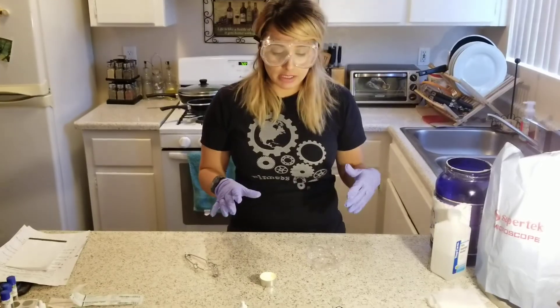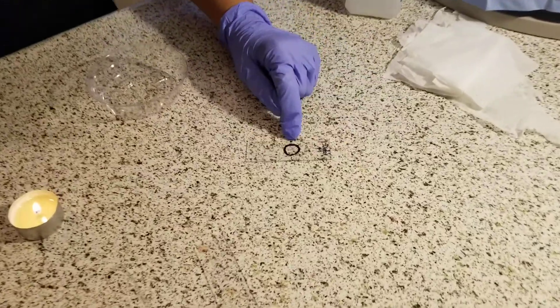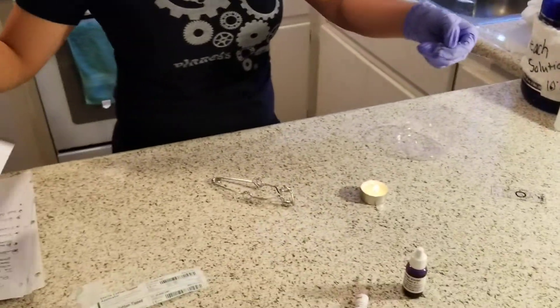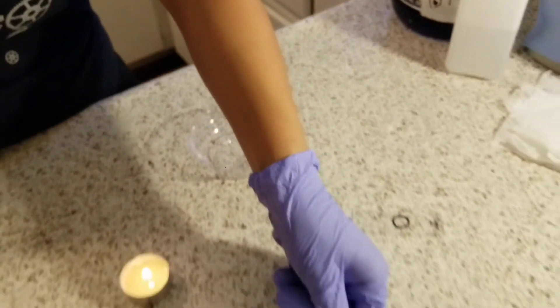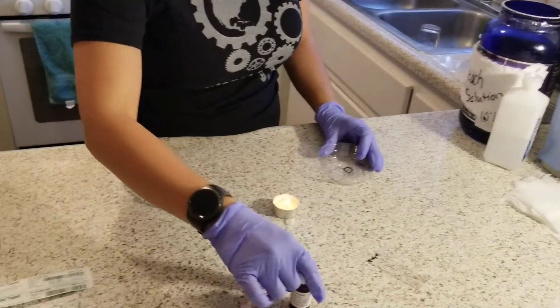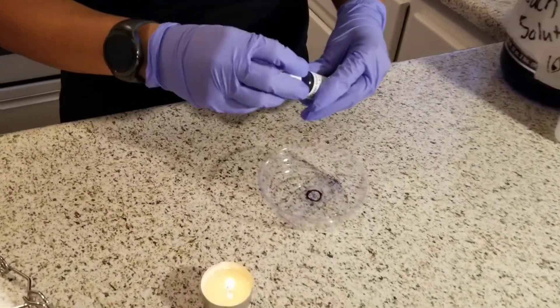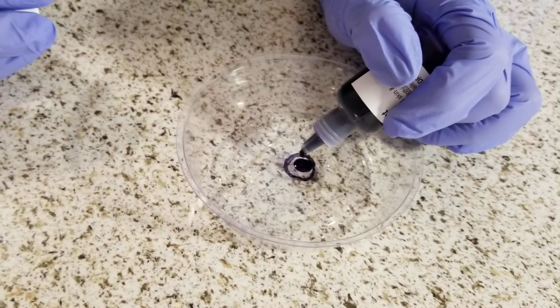Now I have let my first slide sit for about 10 minutes and cool after the heat fixing. As you can see on my second slide, there is no more liquid, so this one is actually ready to view under the microscope — you can see the red from the stain. Now I'm going to stain my first slide. I'll place it in my staining tray and use the crystal violet stain, applying one to two drops to the cells. I'm going to let it sit for about 60 seconds.